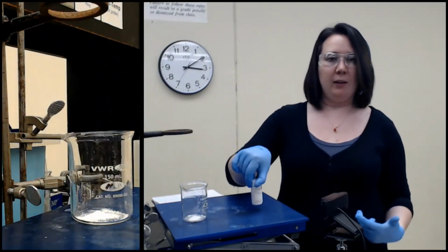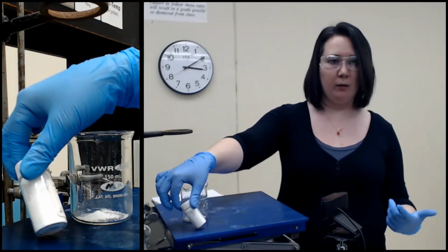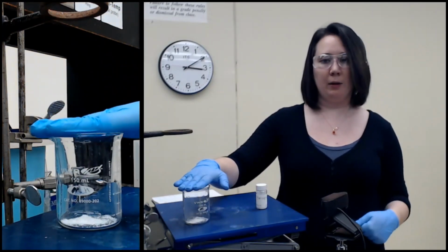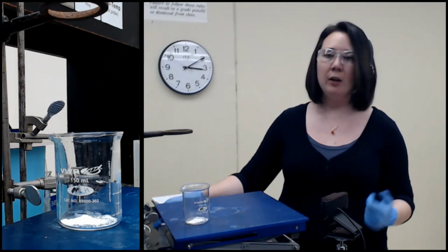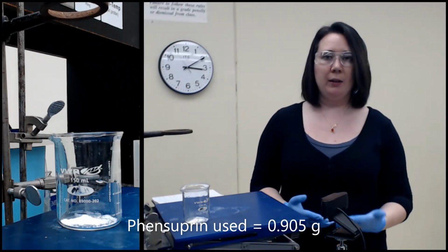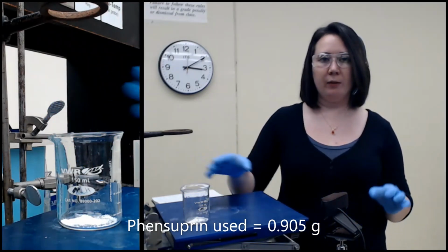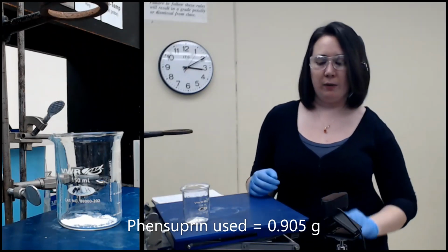I mixed everything together and then I took it to a mortar and pestle to try to make it uniform, mixed it up, and then I measured out some amount here, and that's what we're going to be working with. So again, Phensuprin is a mixture of sucrose, acetanilide, and acetylsalicylic acid. So they all have 3 unique structures, and more importantly, they have unique functional groups. And we're going to take advantage of those differences in functional groups to actually isolate each one of the components.